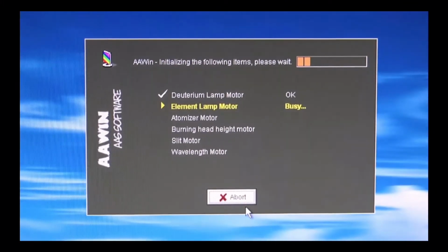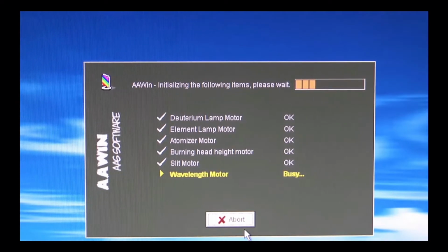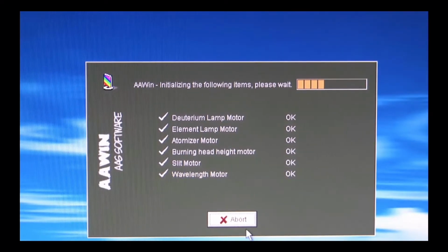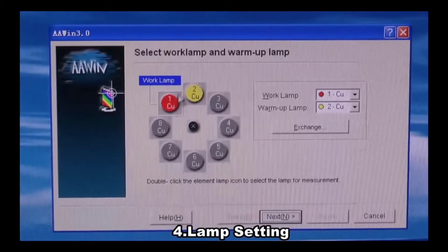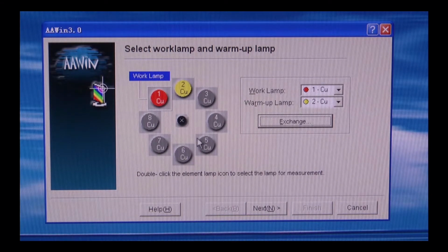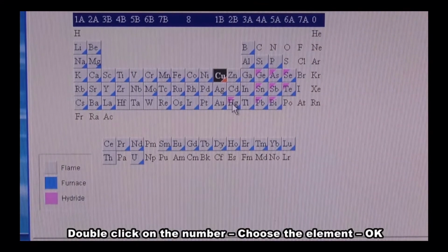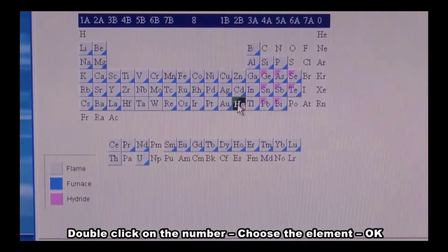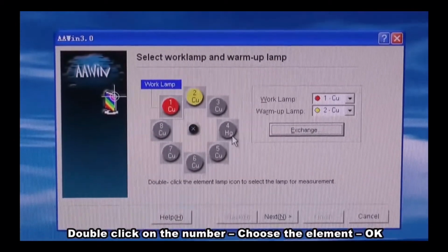The system will initialize automatically. The initialization takes a few minutes. Now the initialization is finished. It will show you how to set up the lamp. There are 8 positions in the lamp turret, so you can choose the element of its position by double-clicking on the position number. For example, we're going to double-click on number 4. Because now in the lamp turret is a mercury lamp, so we click on mercury and press OK. Now the number 4 position has been changed to mercury lamp.